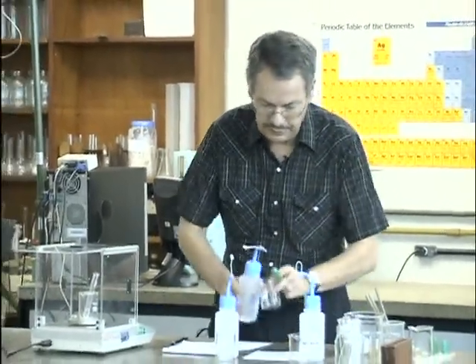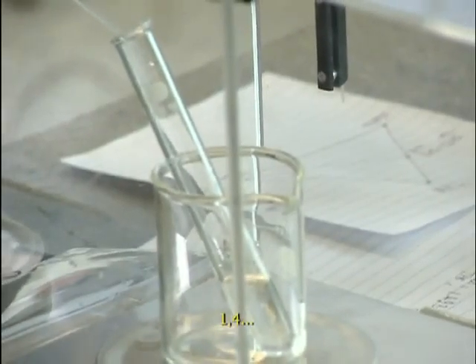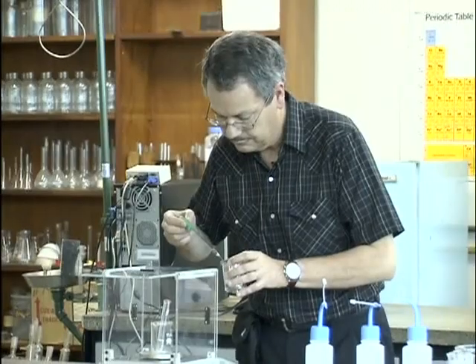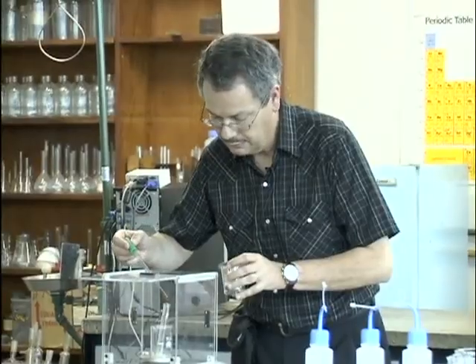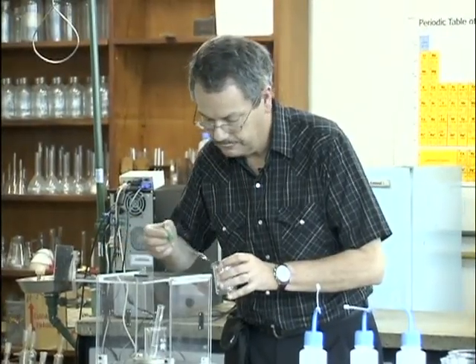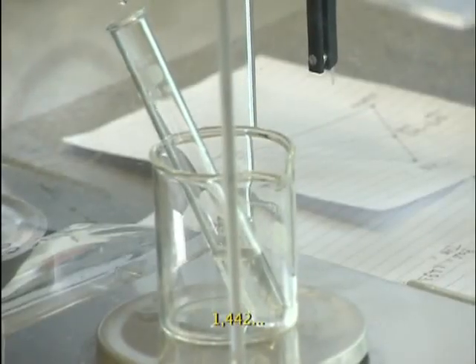I'll put some in here. 1.3, 1.4, 1.9, 4.2, 1.442.